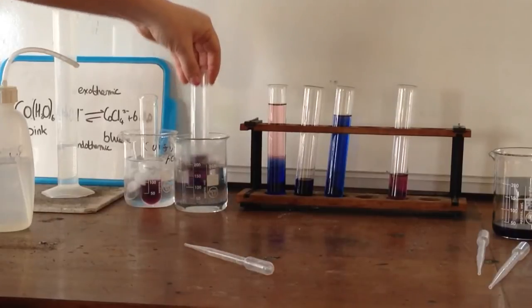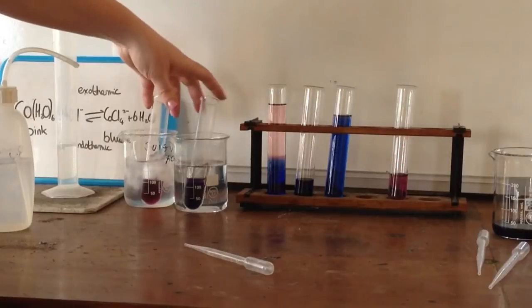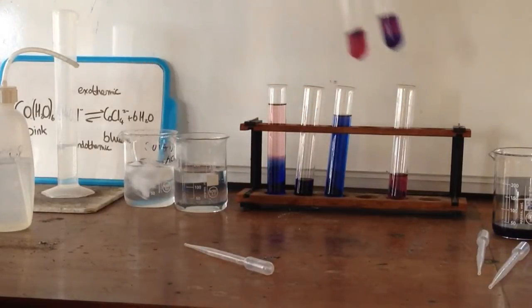Just give these a mix. You can see this one is going a lot darker and this one is going a lot lighter. I'll just put these back in there for you.